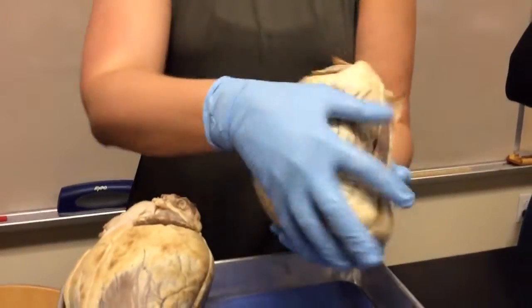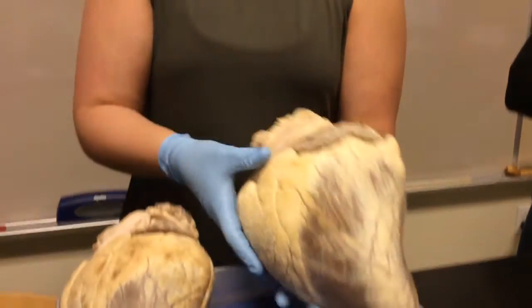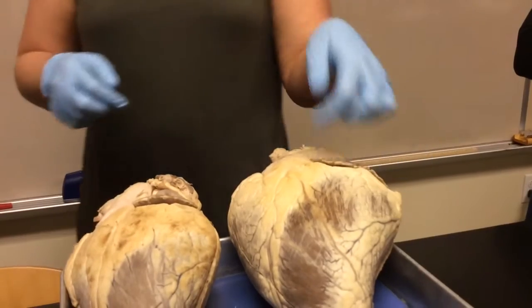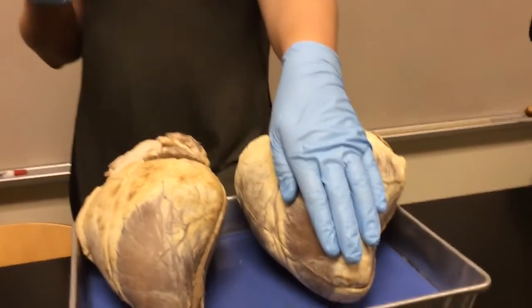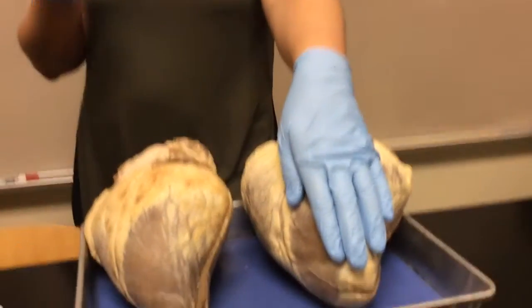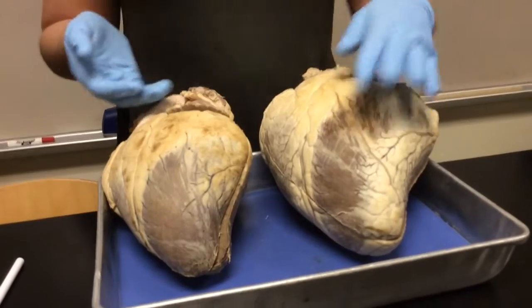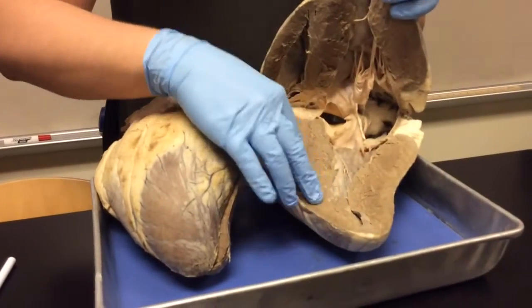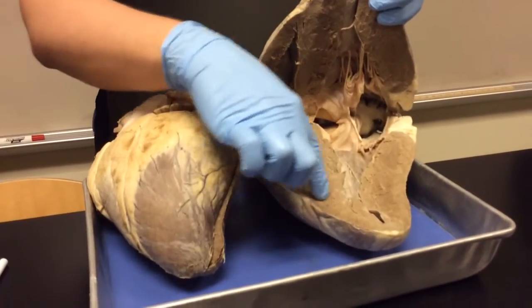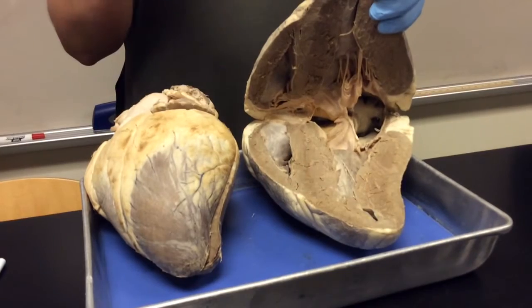If you're just touching the heart itself, the outside of the heart, this is called the epicardium. It's so tightly adhered to the heart that it's almost impossible to tease away. It would be a thin layer of epithelium that creates a serous fluid to help lubricate and reduce friction. Okay, this is the epicardium. When you open up the heart, does everyone see that there is tissue that surrounds the cavities, and then there's a smooth tissue that actually lines the cavities?